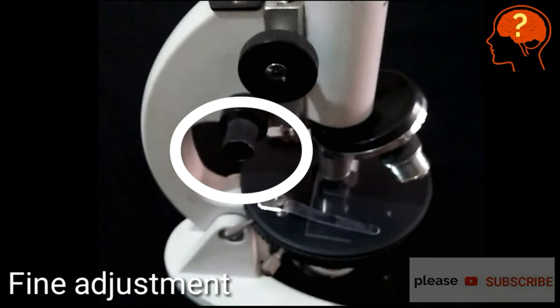By rotating the fine adjustment, you can get more detail of the specimen that you have placed on the slide.